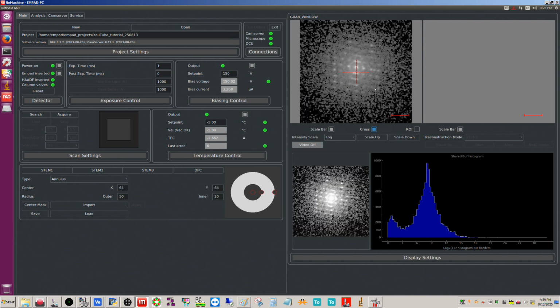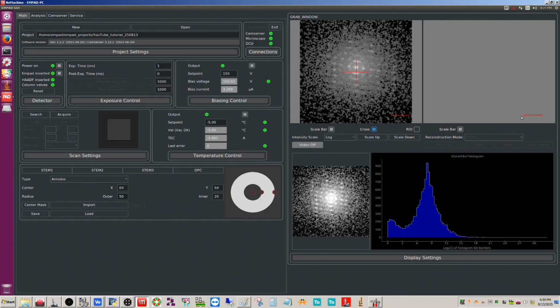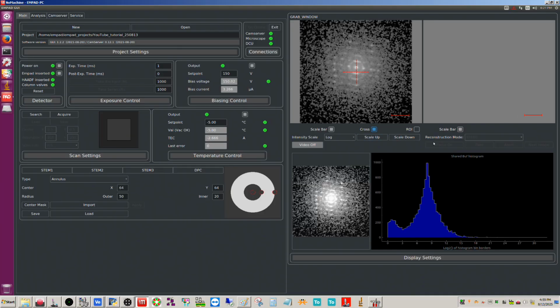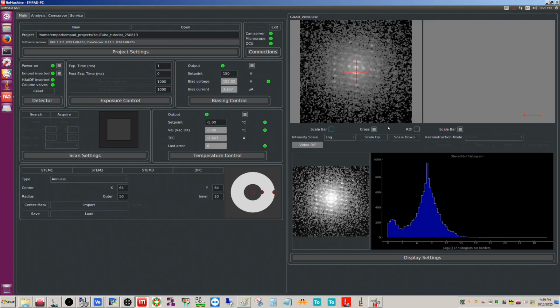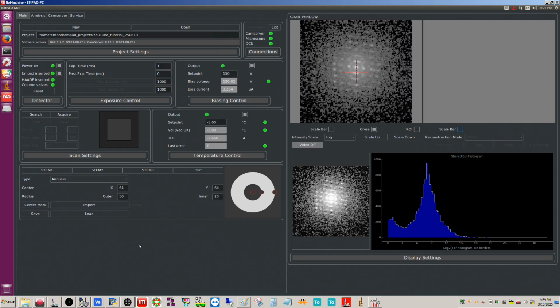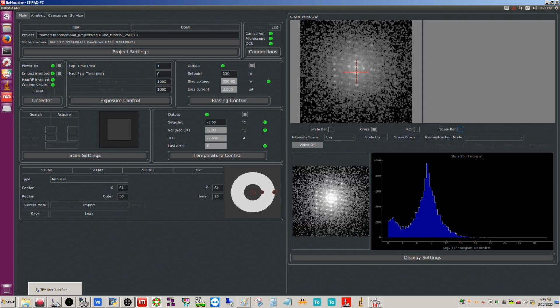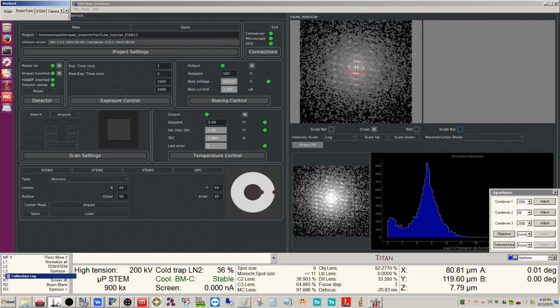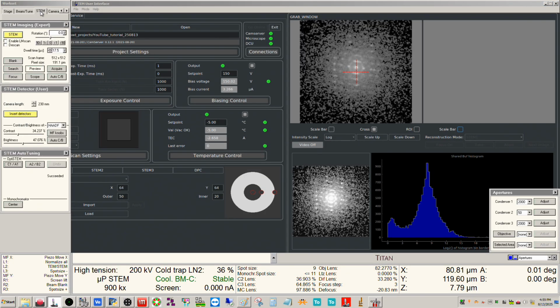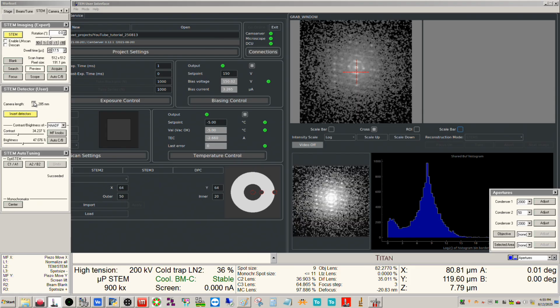The cross here is useful because this defines the center. The scale bars don't really have any meaning. You have to do these calibrations yourself, so you can leave it checked or unchecked. I'm just going to uncheck it to clear this up a little. But I am going to increase my camera length back up to 720.